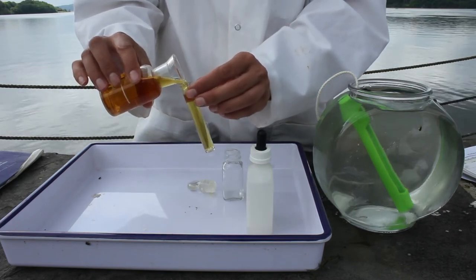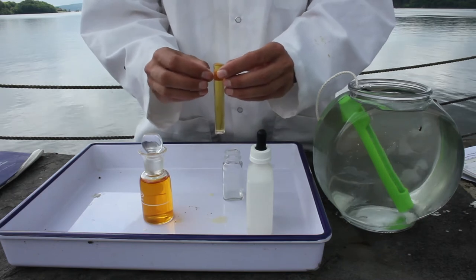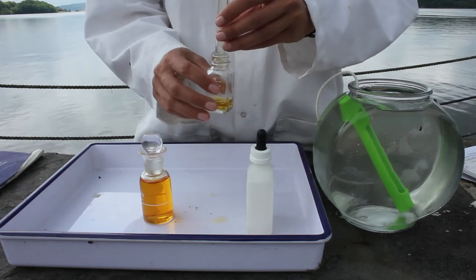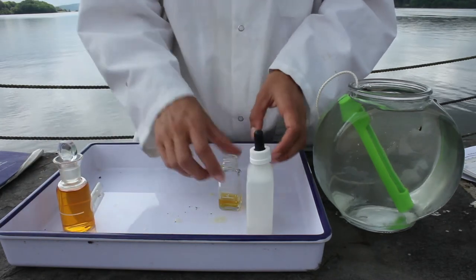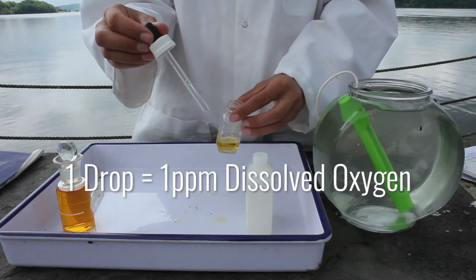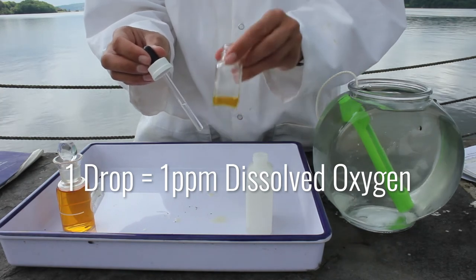I'm going to start out by measuring out a sample. The way this reverse titration works is that we are going to slowly break the bonds between the iodine in here, which is dyeing the oxygen yellow, until we get totally clear. And then we'll know how much dissolved oxygen is in this water. This sodium thiosulfate is what's going to break the bonds. One drop of this is equivalent to one part per million dissolved oxygen. We'll keep going until this sample is clear.